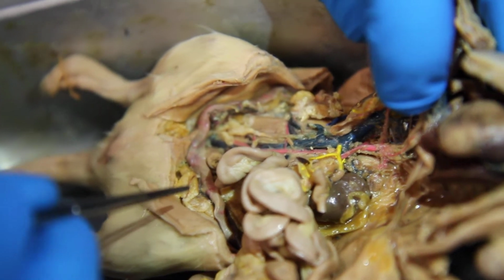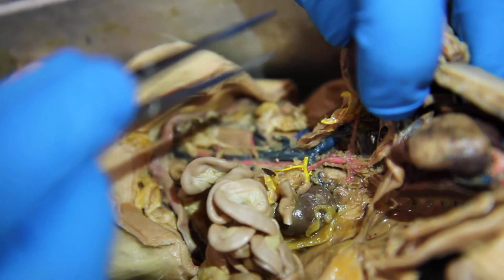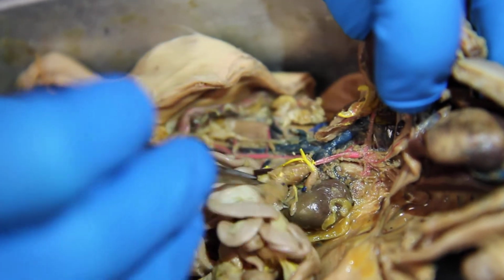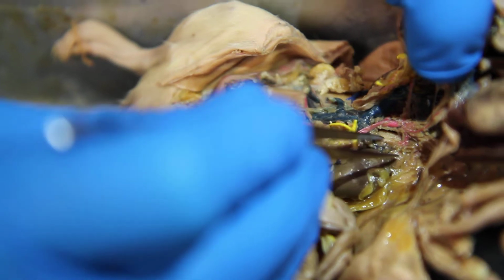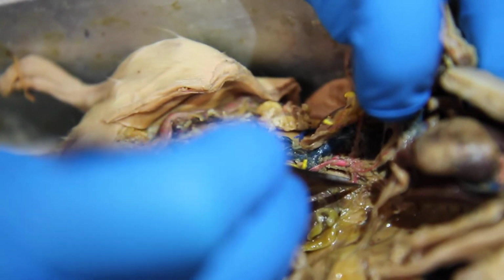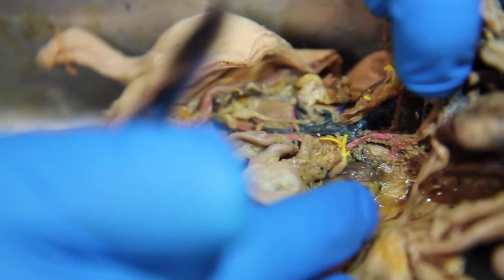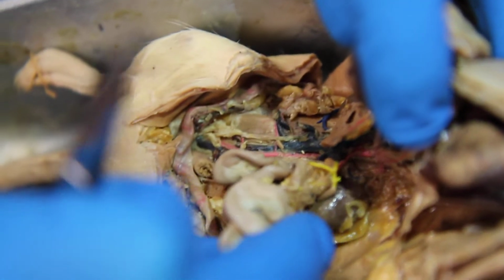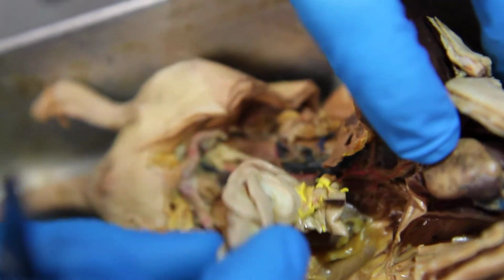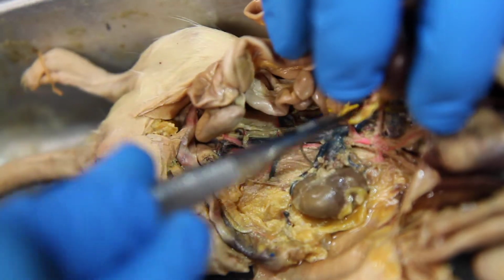Those are also really small arteries, and they're kind of hard to find, but if you can see where it's going, there's the kidney, and on top of the kidney, remember where the adrenal gland is? It's right there. So this one has to be the adrenal artery. All right, the next one, there's a branch that's coming off. It's called the celiac artery, and it splits in three.